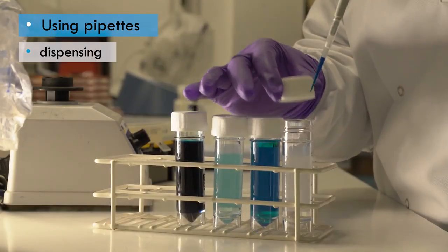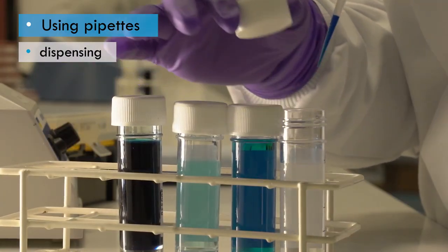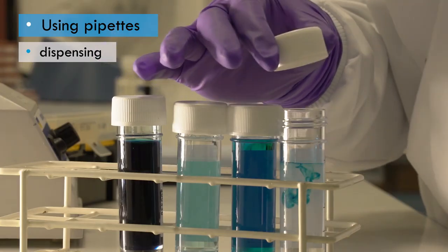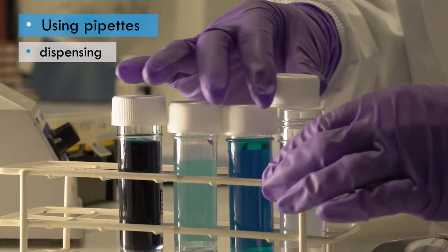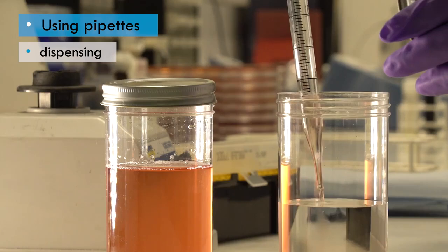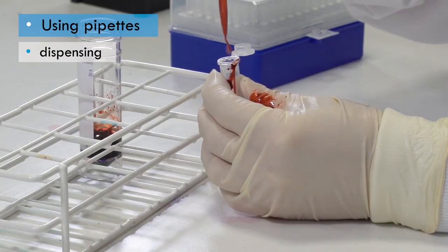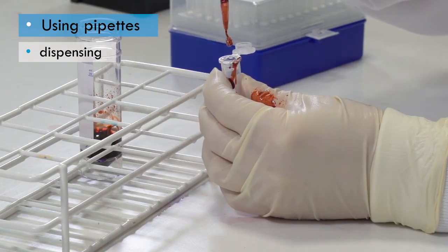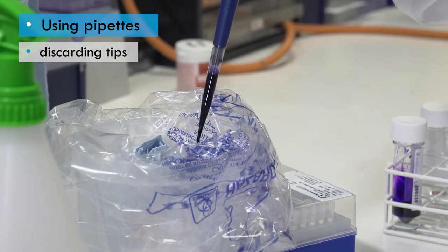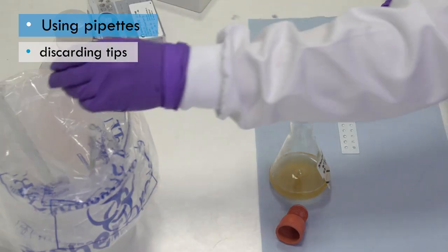Hold the tip just inside the container into which the liquid is transferred, and just above the surface of any other liquid in the container to avoid splatter, splash or aerosol. This also prevents any liquid that may be on the outside of the pipette tip from being transferred. Dispense the liquid from the pipette or pipette tip slowly. Because they use air displacement to push the liquid out, there is the possibility that if used too quickly, it could create an aerosol or splash. Eject the tip or drop the pipette itself, for example if it is a Pasteur pipette, carefully into the waste container.